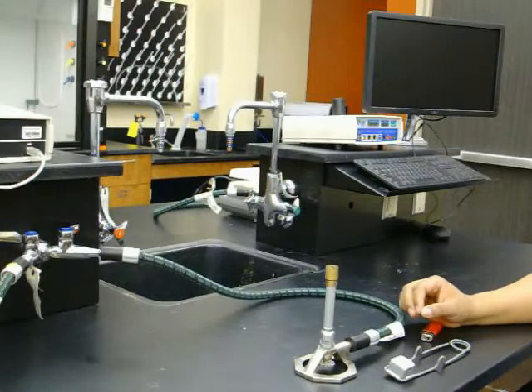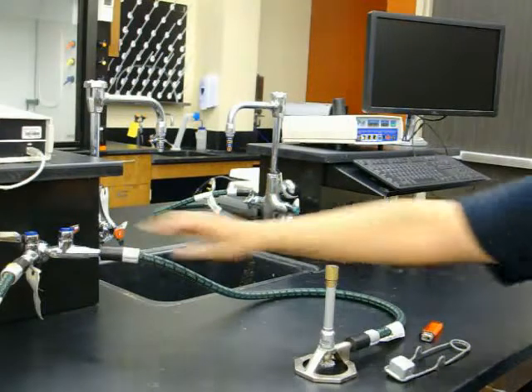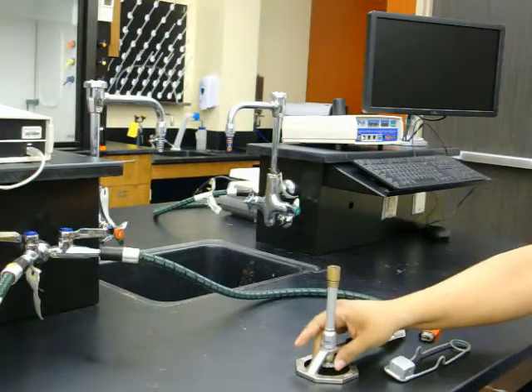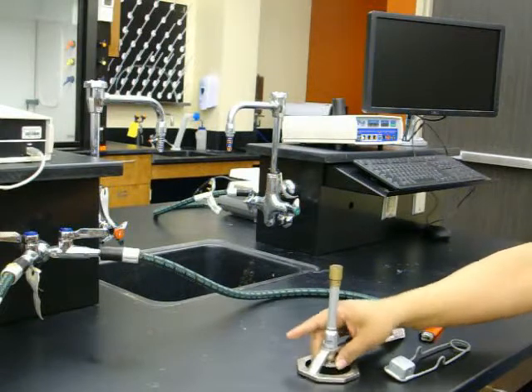When using a striker, turn the main valve on parallel to the hose. Open the gas valve at the bottom of the Bunsen burner and produce a spark by the side of the barrel until ignition.